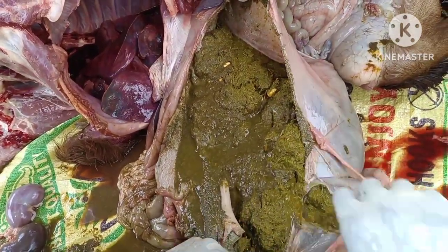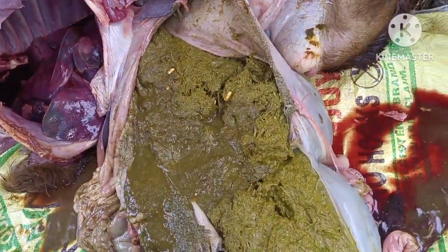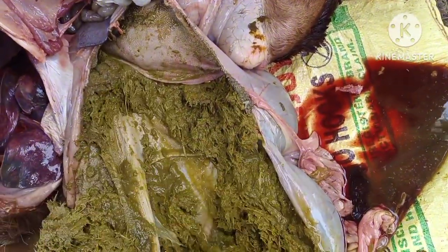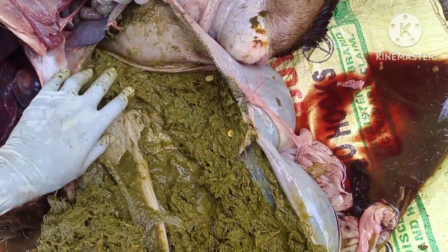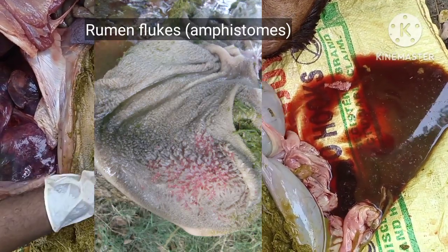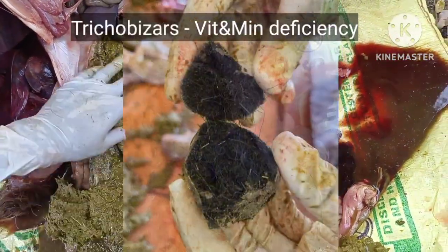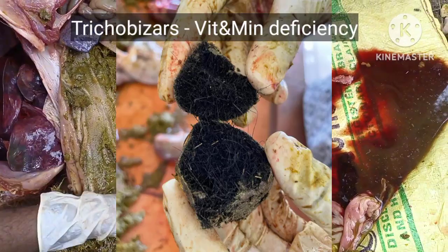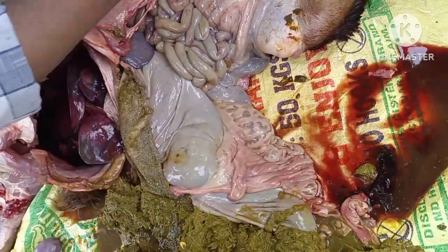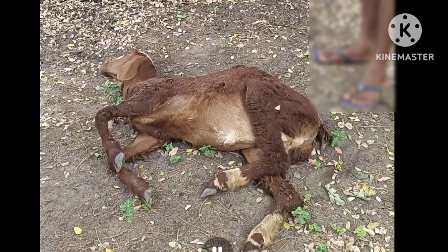And if we see here, there are many undigested maize seeds. And if there is a severe amphistome infestation, then these amphistomes will be adhering to the mucosa of the rumen. If the animal was suffering from severe vitamin and mineral deficiency, it takes its own hair, and this hair forms into a ball-like structure in the rumen. Like this, if we conduct postmortems regularly on the dead animals, we can give a better treatment to the animals that are alive, and we can relieve their suffering.